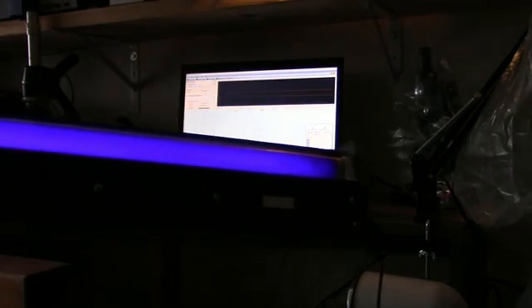Next, I'm going to use a fluorescent black light and see if we can look at the spectrum of that. So here's the light. There's the black light, and holding it in front of the slit, here you can see the spectral line of this black light, and it looks to be on this scale about 380 nanometers. Now, this is fairly relative. This isn't real accurate, but it gives you an idea. So, 380 nanometers.